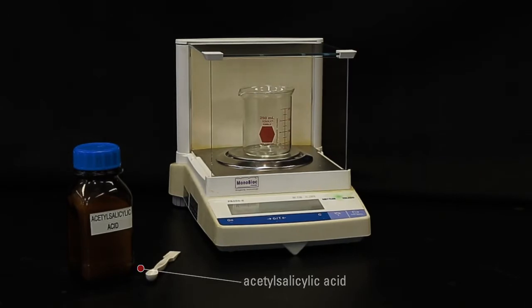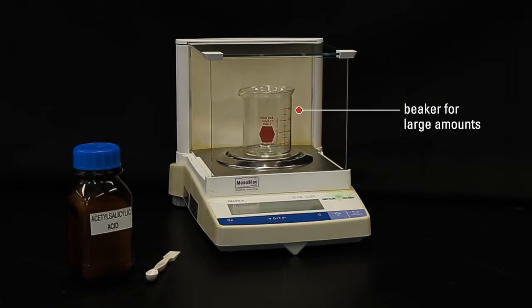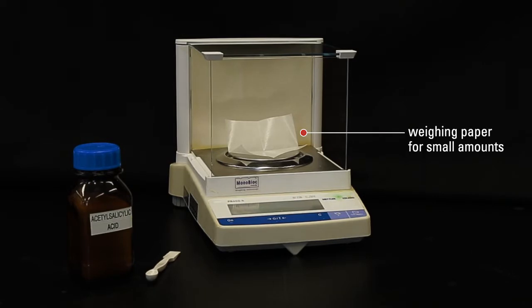If you are weighing a large amount, you will use a container such as a beaker. But if you are weighing a small amount, you will use weighing paper.